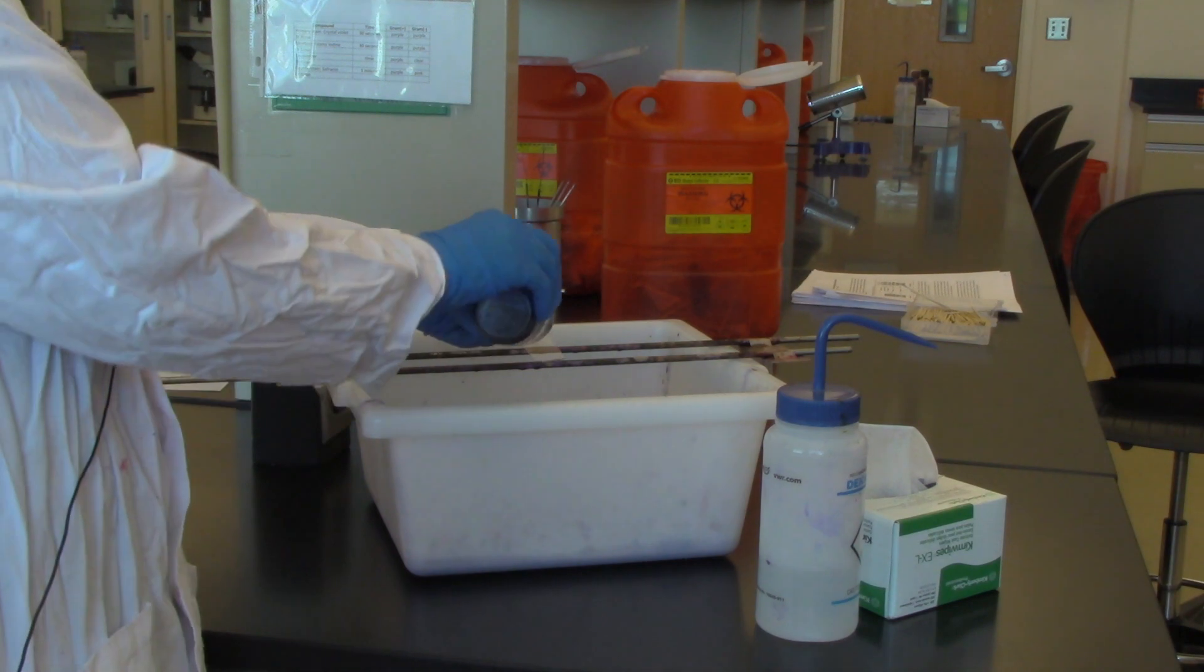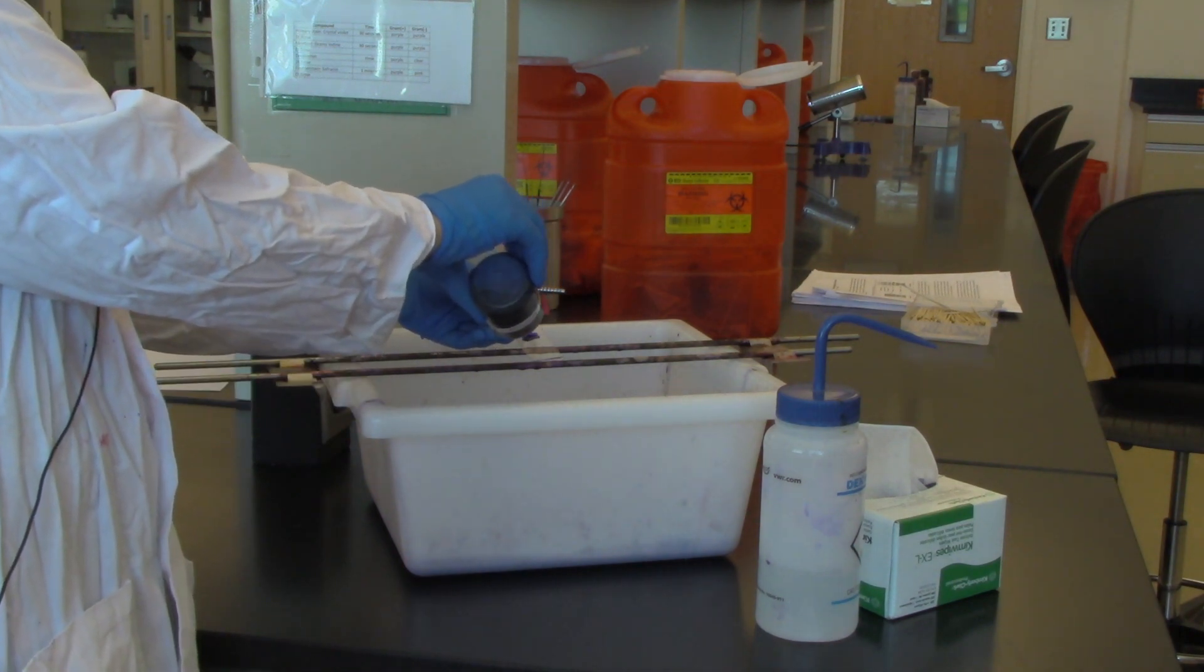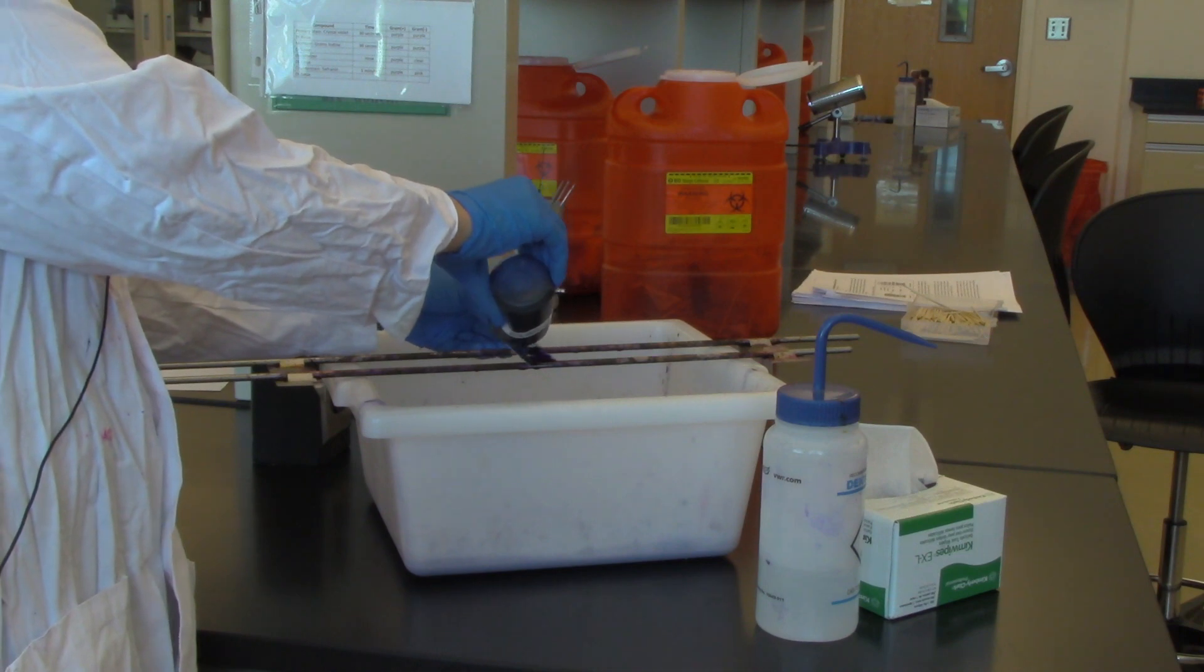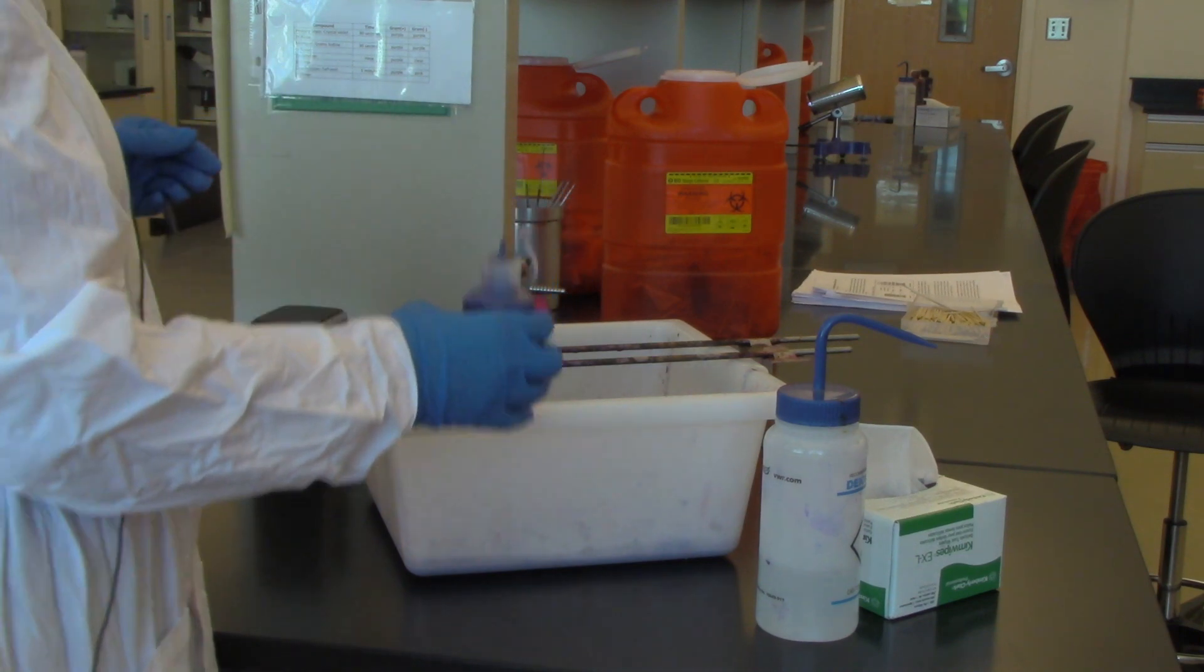So I'm going to flood my slide and I'm going to tilt this here just so you can see it. You would lay it flat and I'm going to wait for 30 seconds.